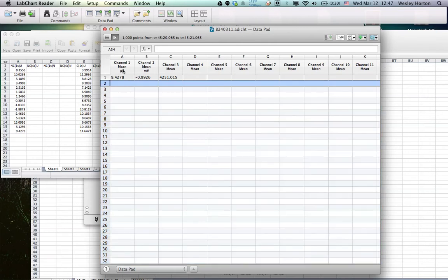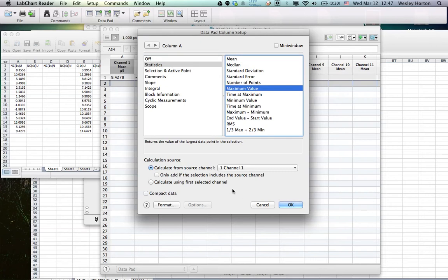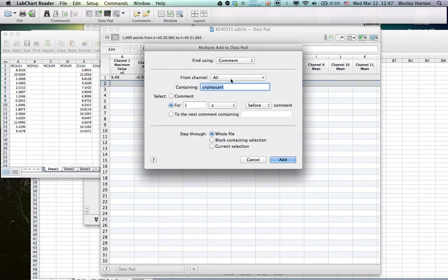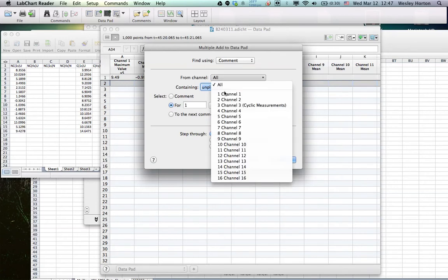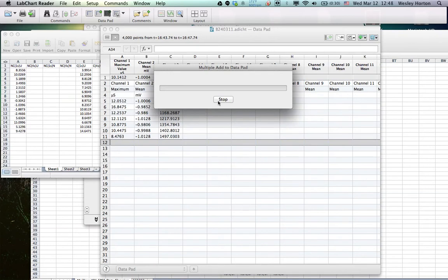All right, so the next step is we want that 4 seconds after. So we're going to double click up here. We're going to go statistics, and we want maximum value. Calculate for source channel, channel 1, and OK. All right, so then we're going to go multiple, add to data pad again. We're going to select channel 1, doesn't really matter, for 4 seconds after the unpleasant stimulus, after whole file.